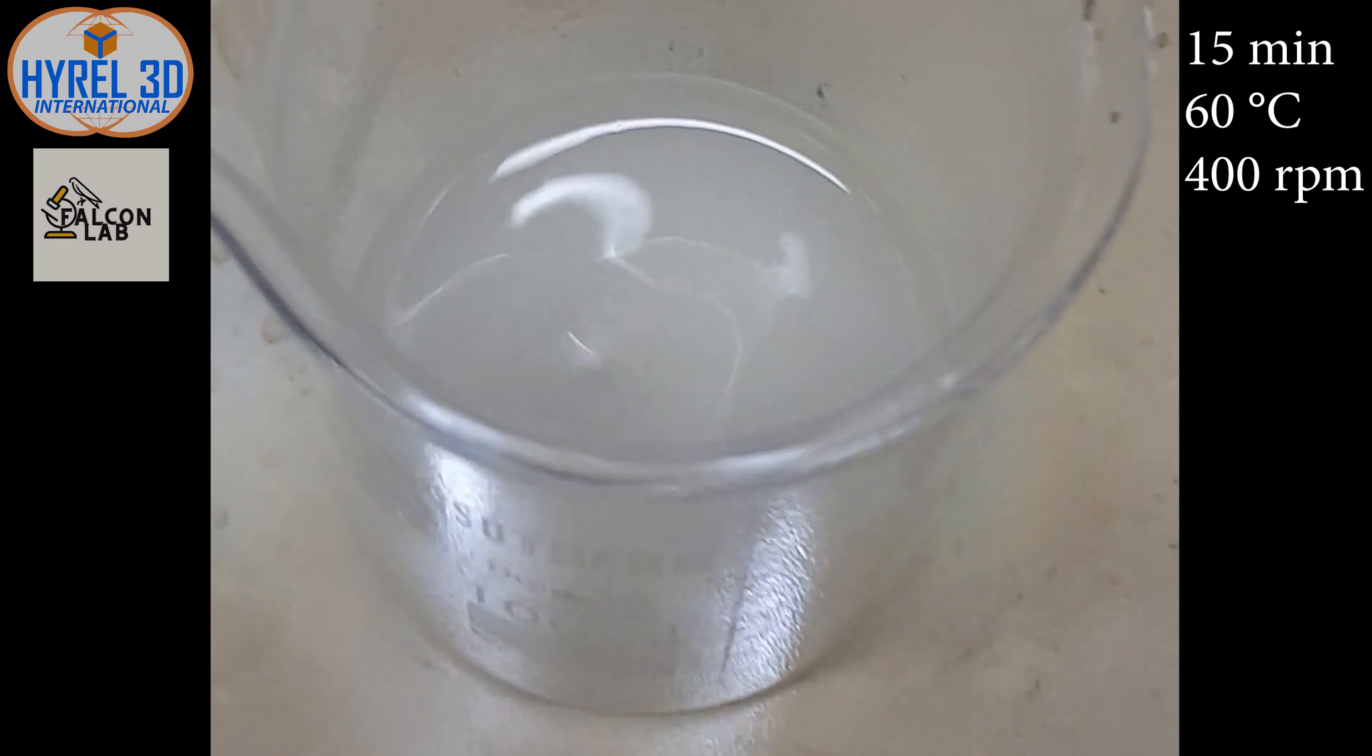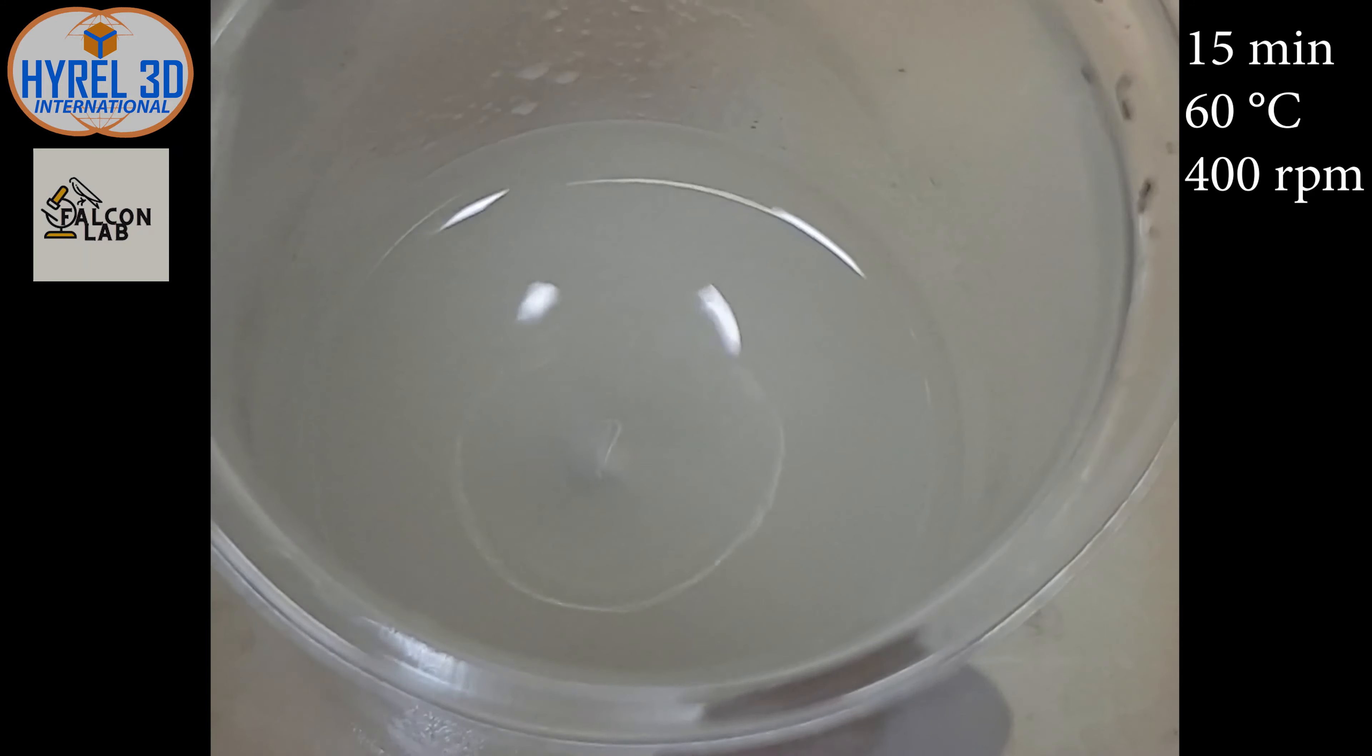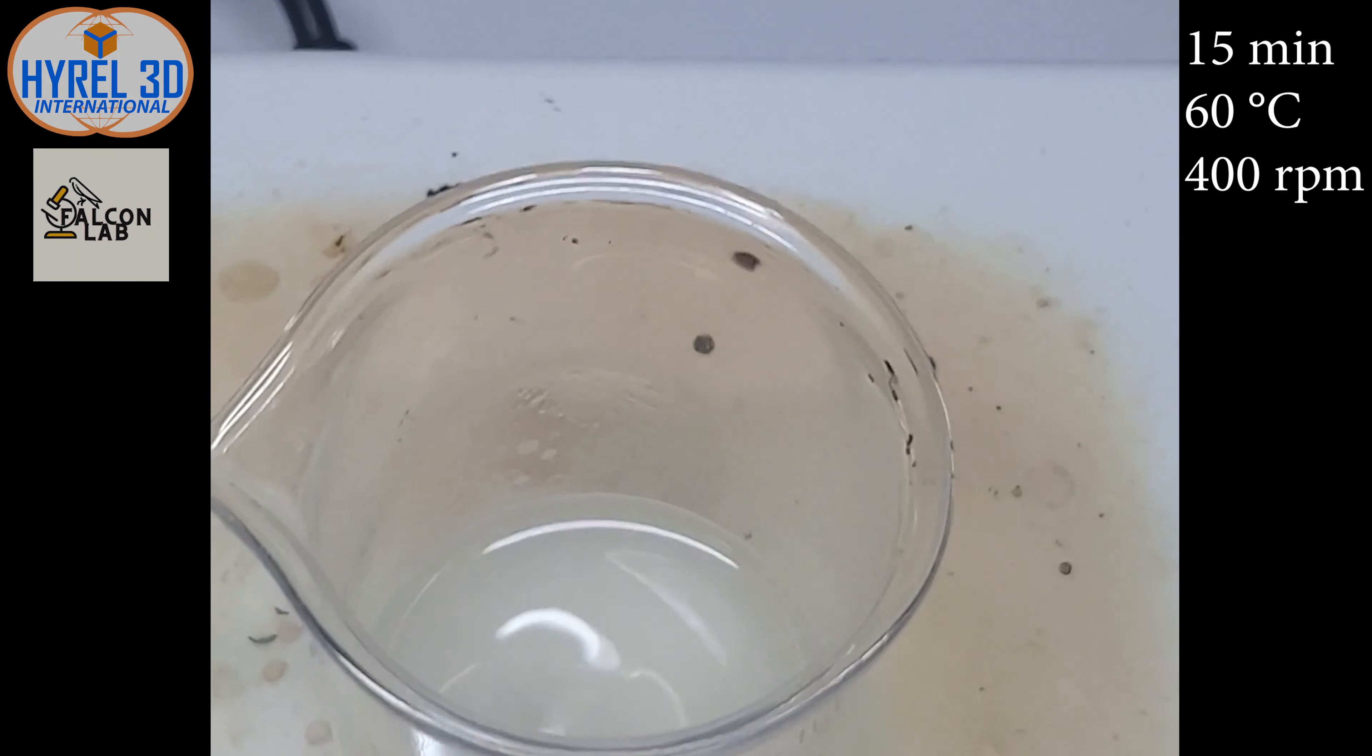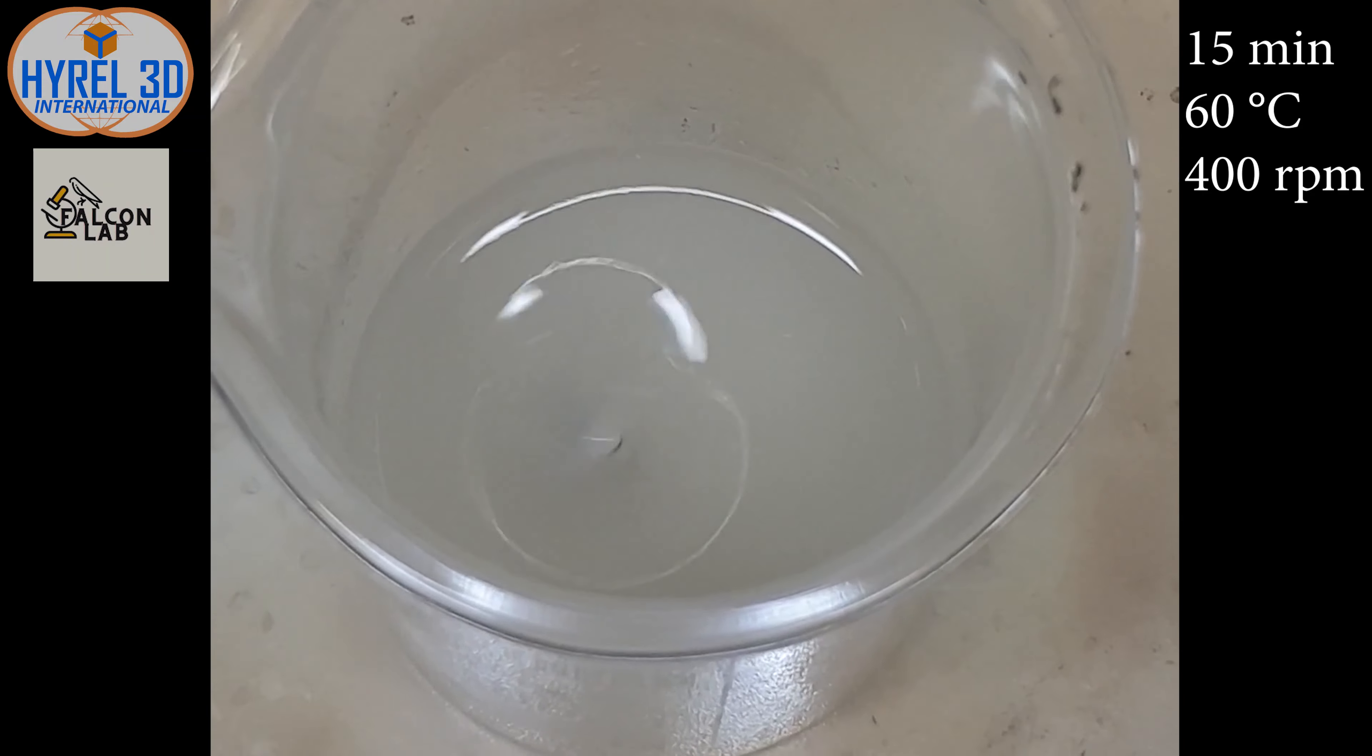I have prepared 20 milliliters of hydrogel. You can watch the mixing process using the magnetic stirrer.